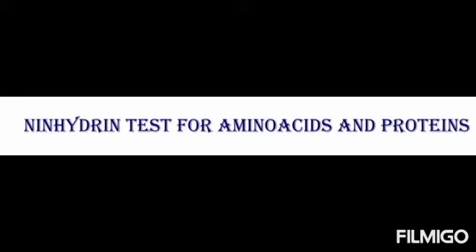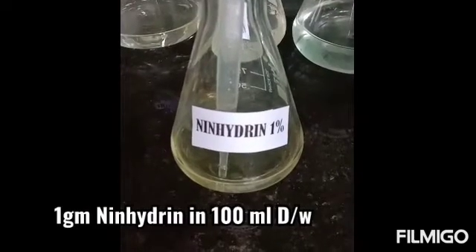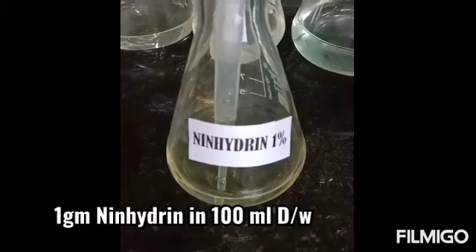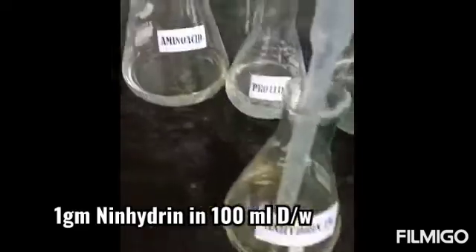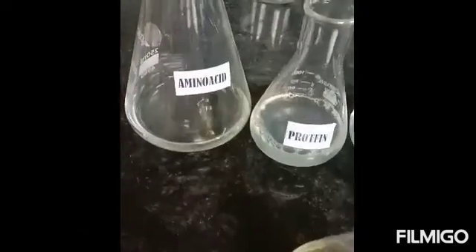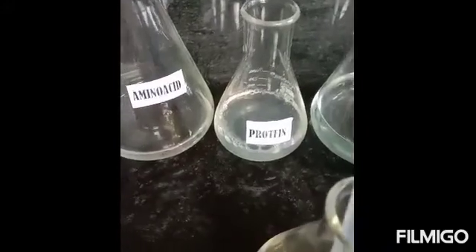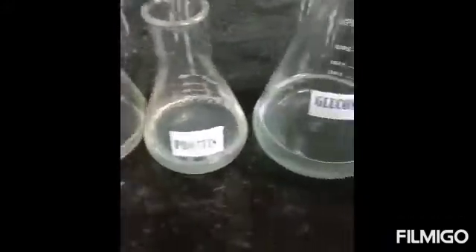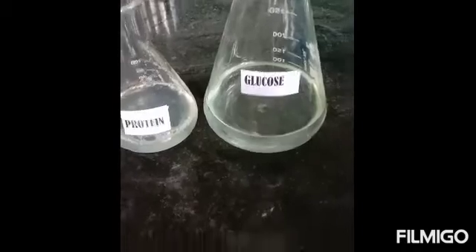This is the ninhydrin test for amino acids and proteins. Here is one percent ninhydrin solution — that is one gram of ninhydrin in 100 ml of water; you can add a few drops of acetone or acetic acid as well. We also have one percent amino acid solution, one percent protein solution, and one percent glucose solution.